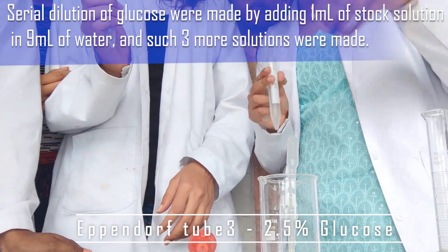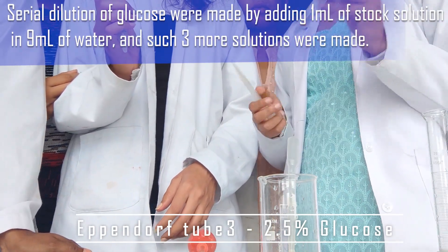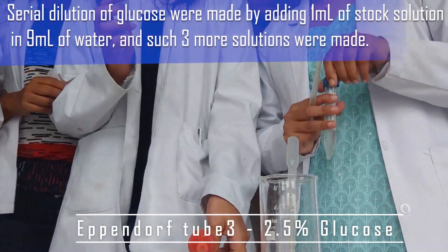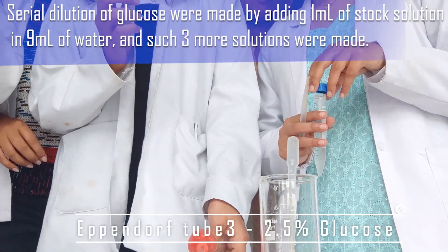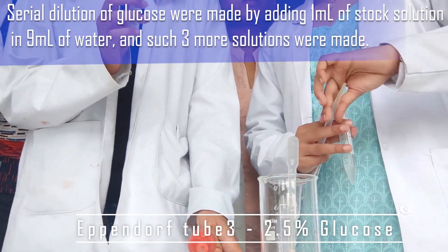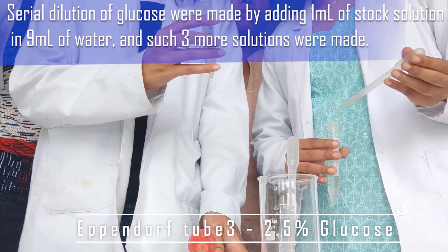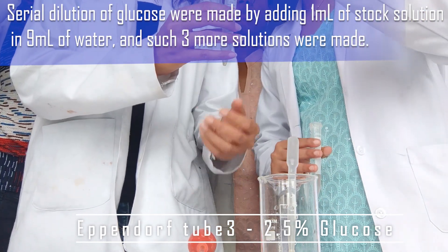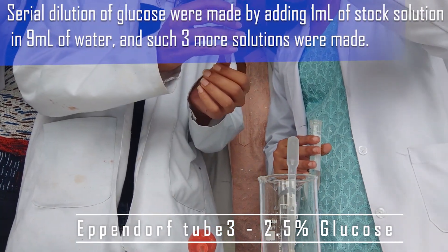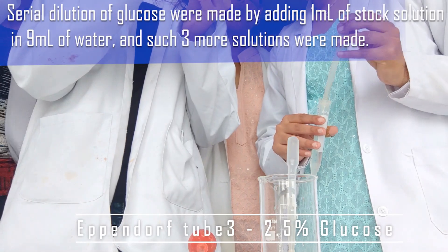Now take the third tube. Take one ml of solution from tube two, add it into tube number three, and make it up to 10 ml. This is our 2.5 percent glucose solution.